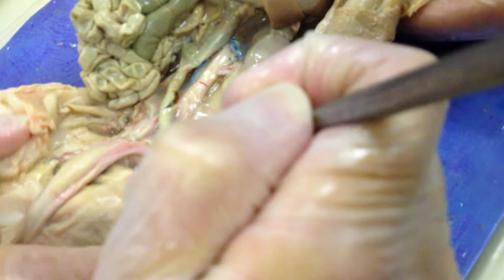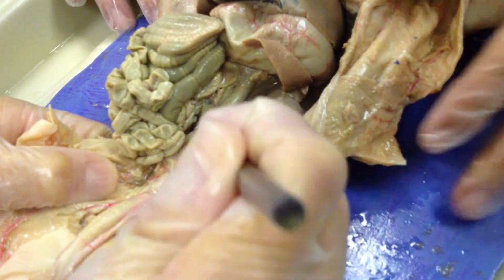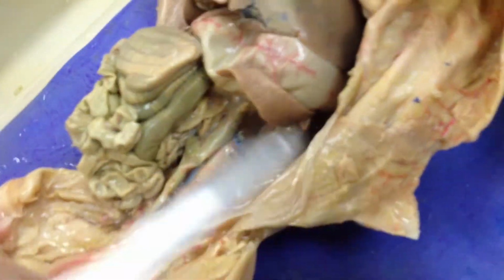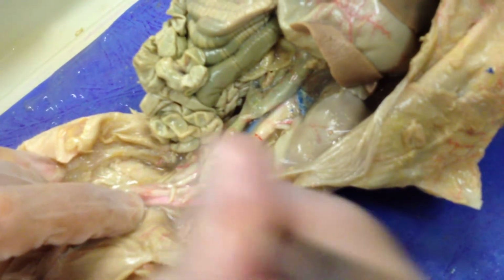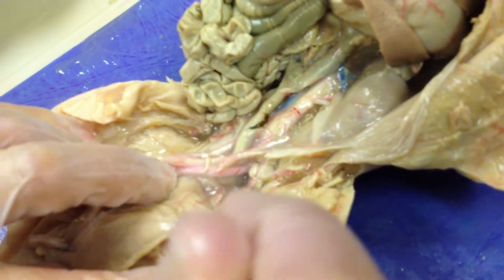Common iliac veins, right and left. Okay. So for the iliac veins, you have to come down here and you follow the aorta. Now, one of the things that's tricky about this is these little pigs have umbilical cords still. So this is the umbilical artery, and you've got to get around that. I'm actually going to cut the umbilical artery just a little bit more, and you get around that and you look deep to that, and you can find the umbilical artery right here, and we just had the vein.